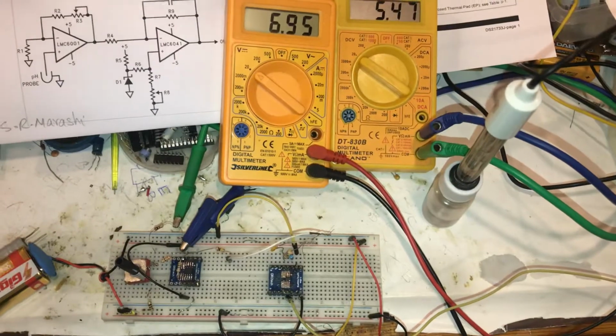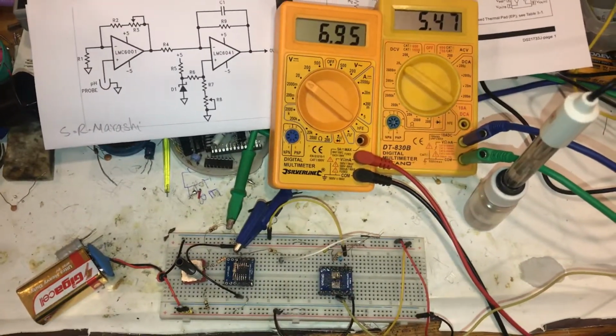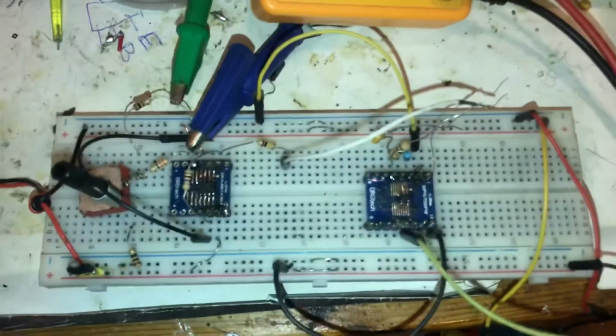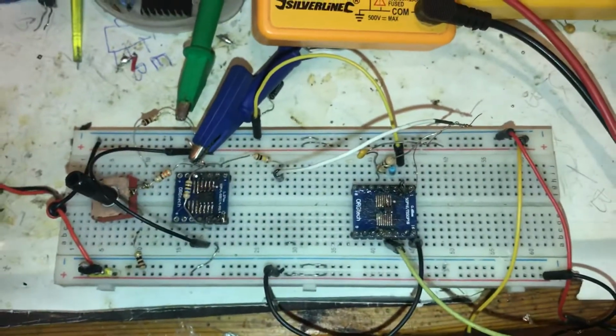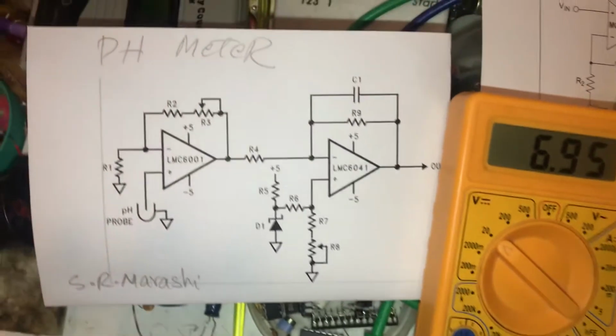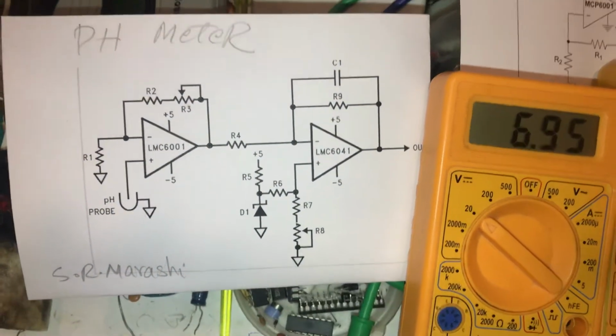The project that I made today is pH measurement with two ICs. This is operational ICs, operational amplifiers. Look at the schematic. We need LMC6001 and LMC6041. I use the MCP version.